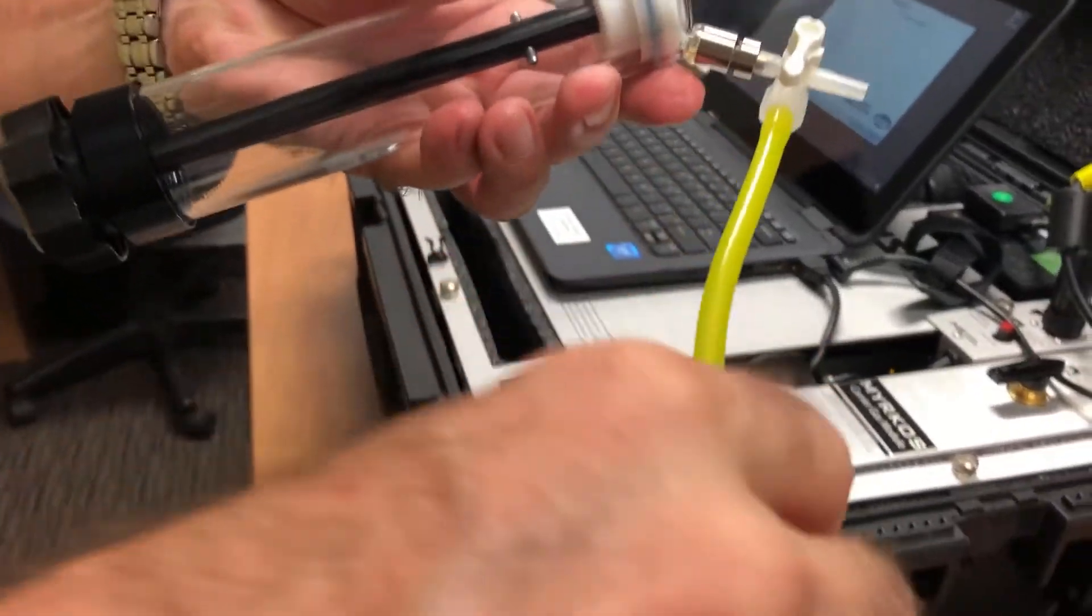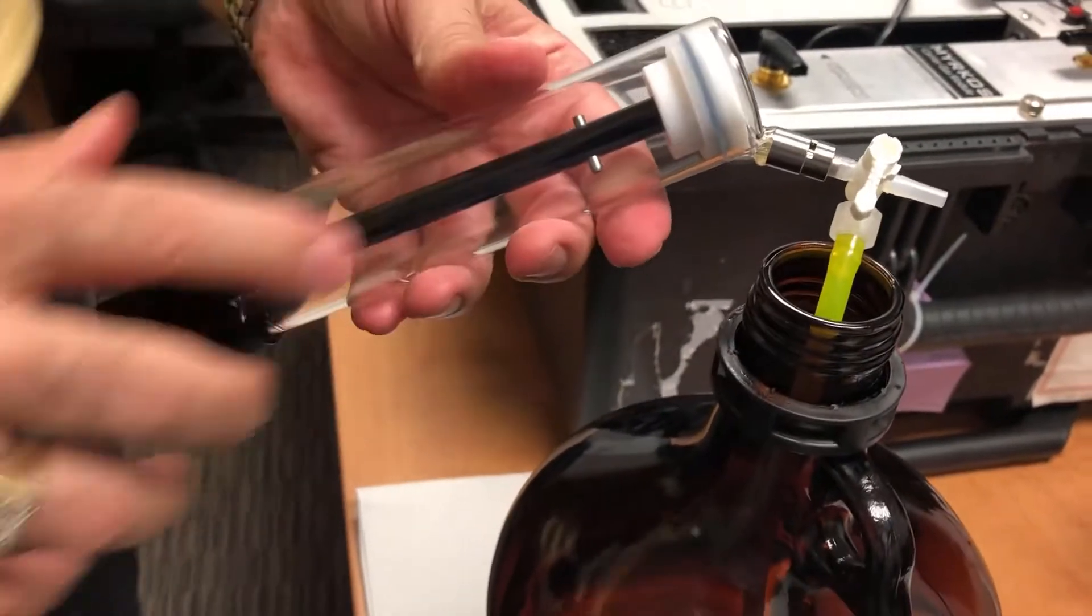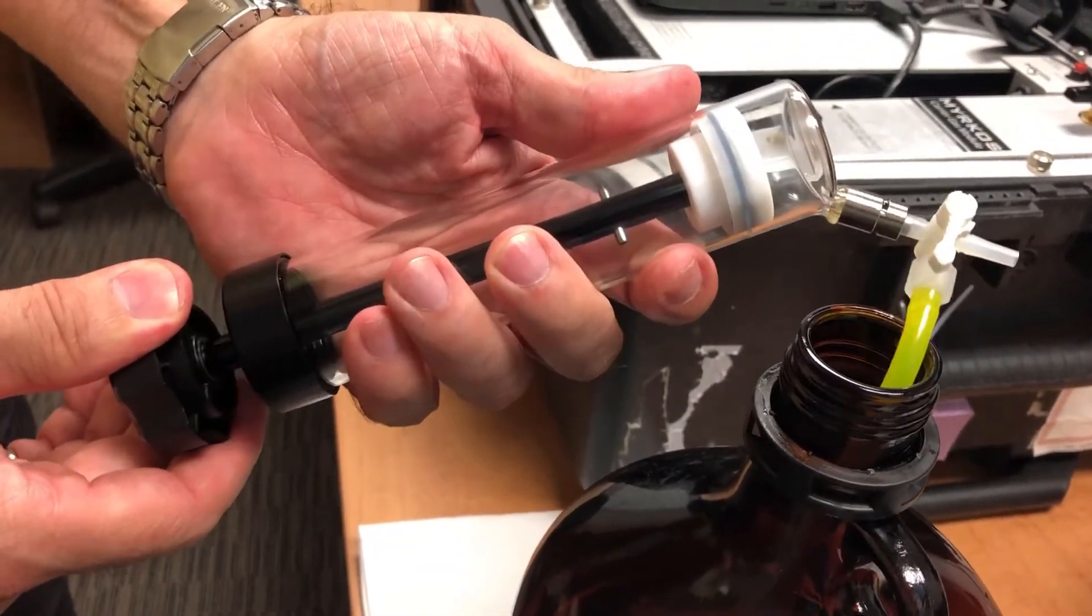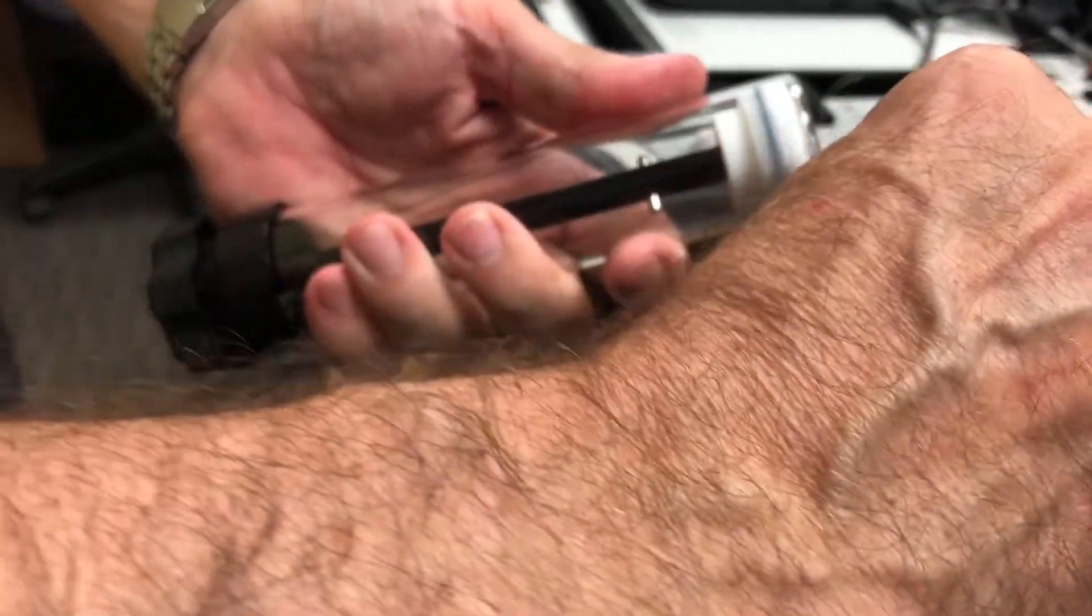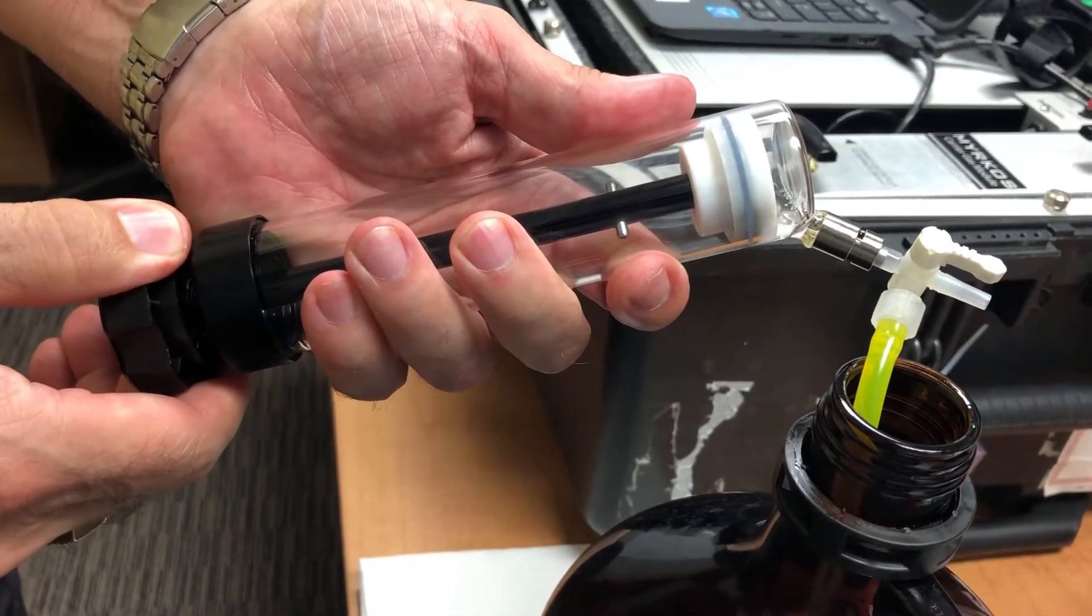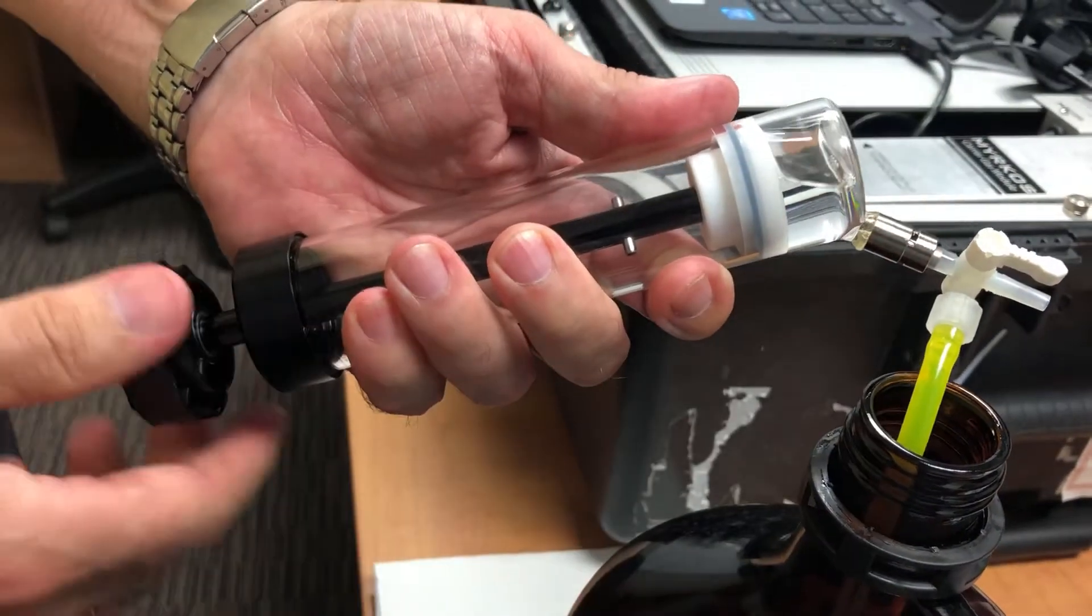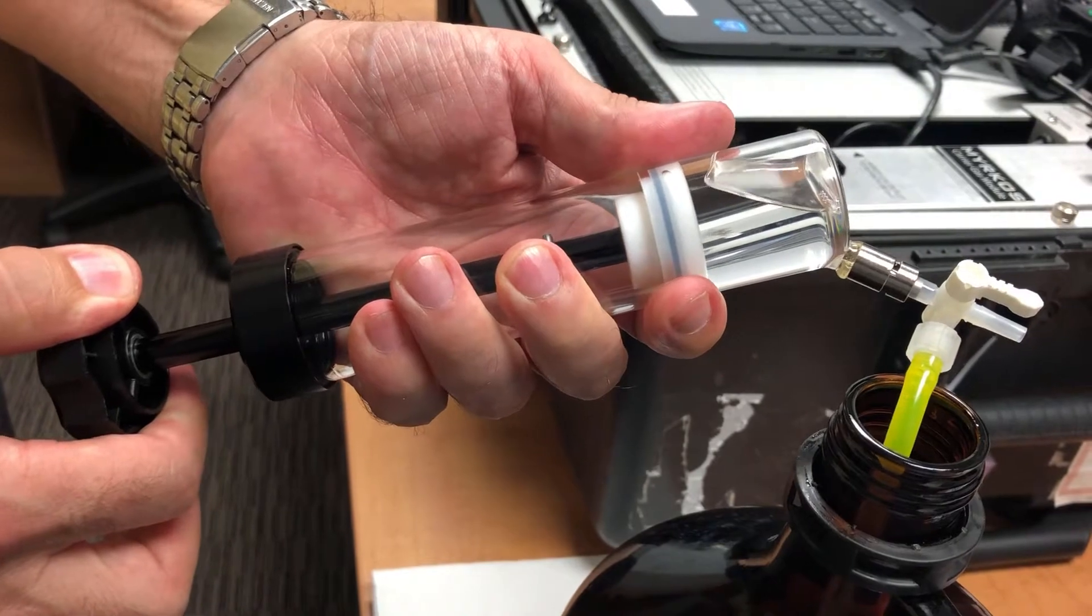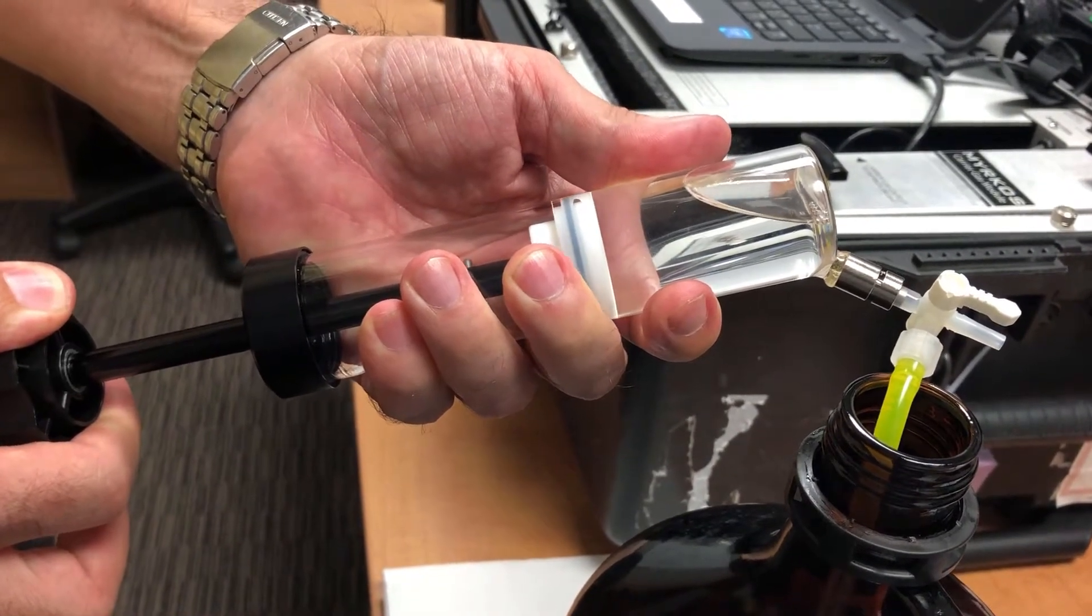So what you do, you have to fill up the syringe and leave no air inside the syringe. So first thing you open it here. Now for sure we're going to have air that's going to come because there was a lot of air into the tube. So what we do is that we fill up the syringe with the oil that we're going to measure.